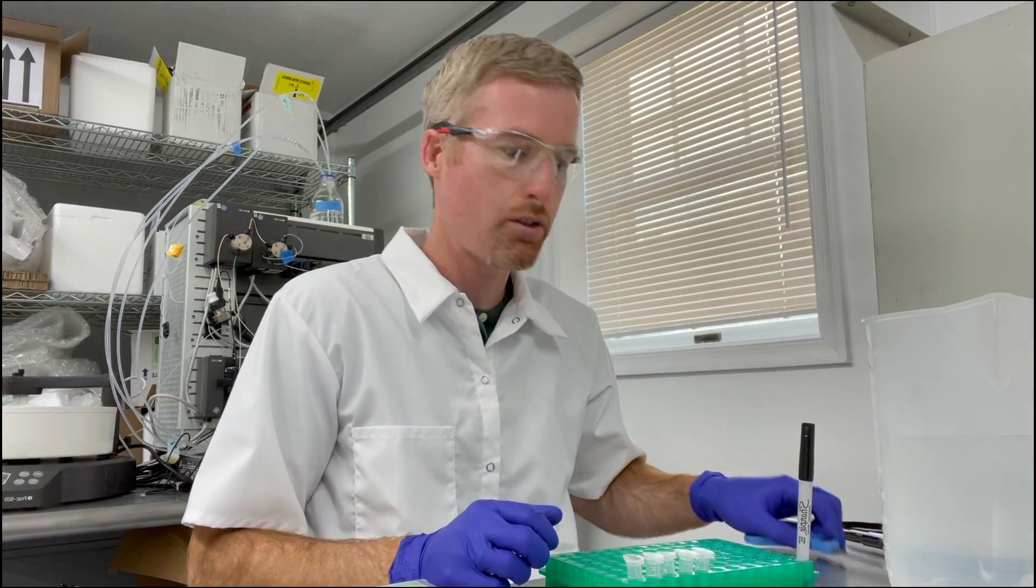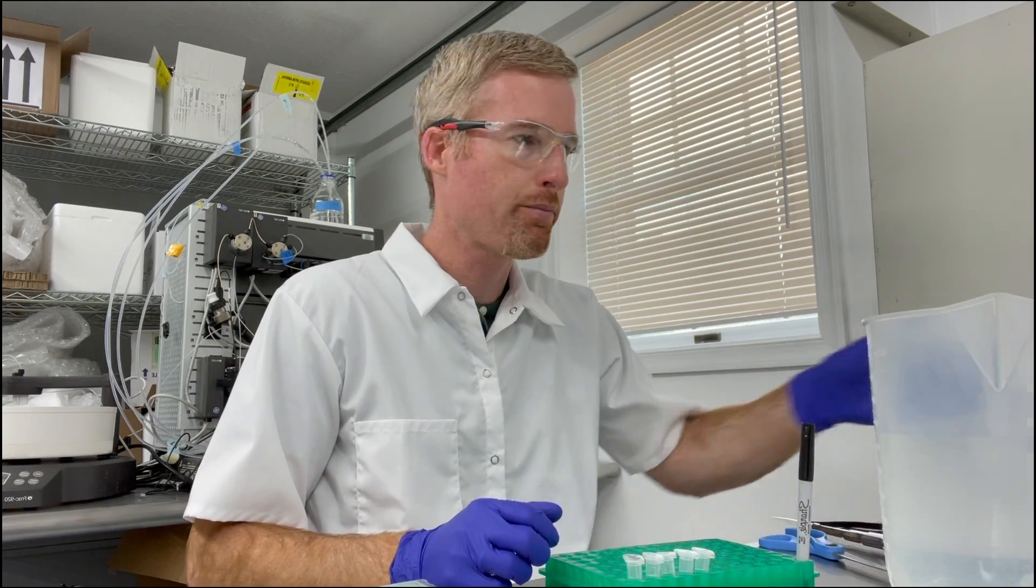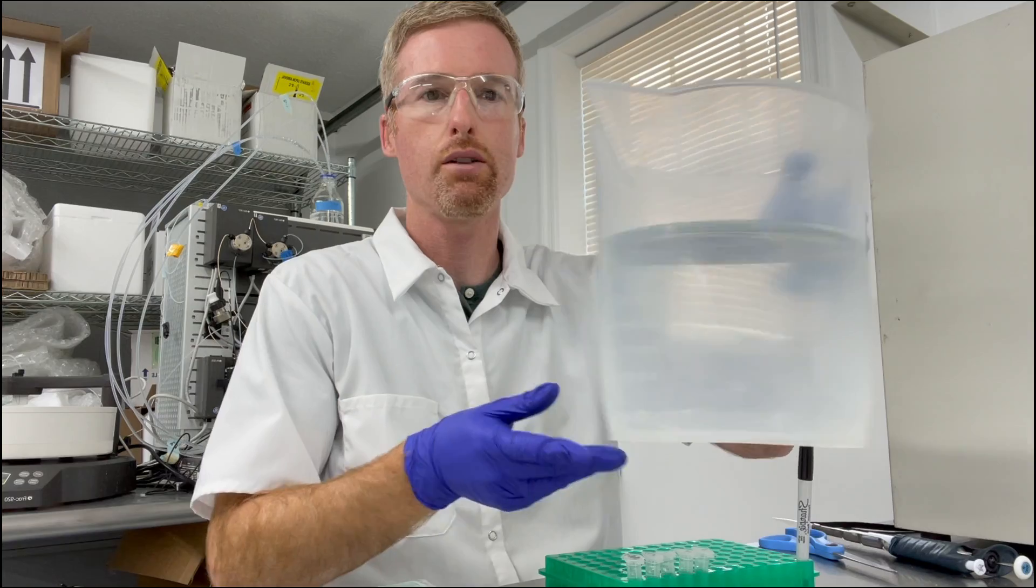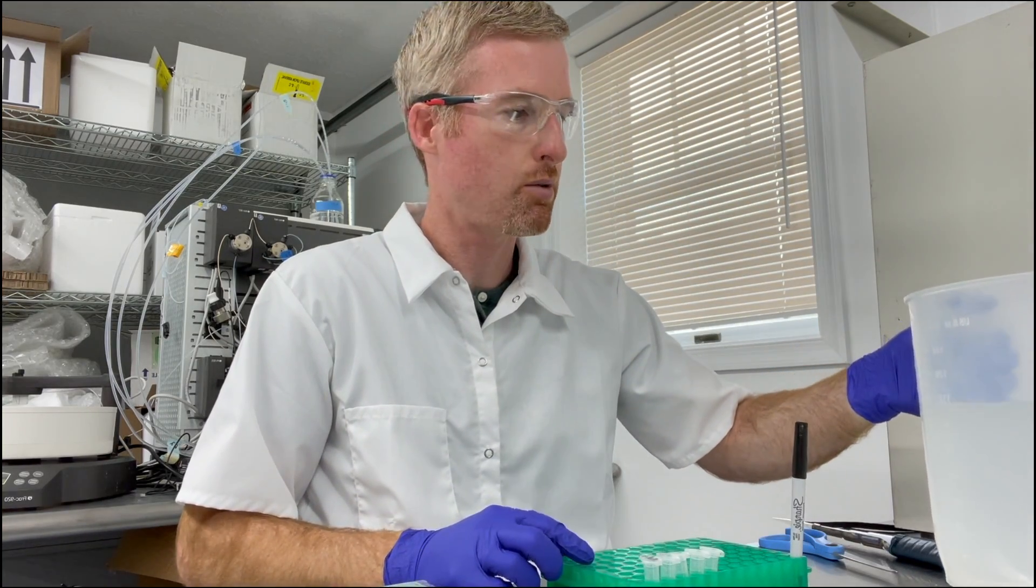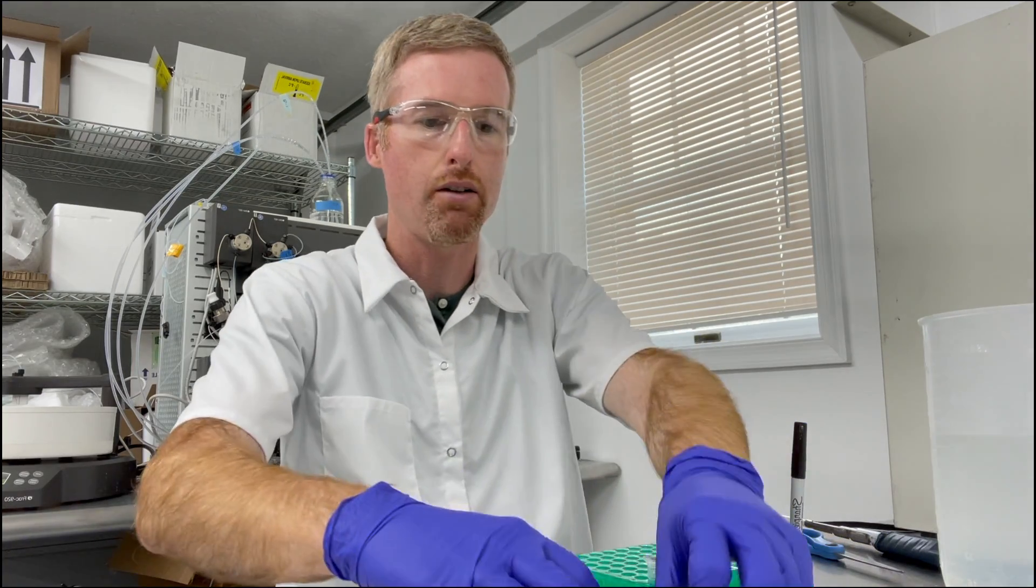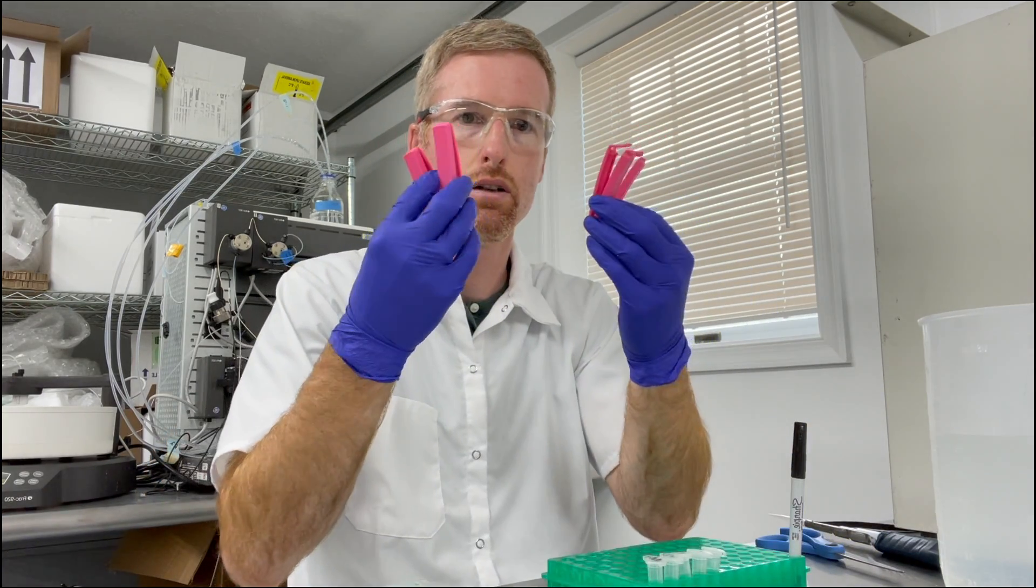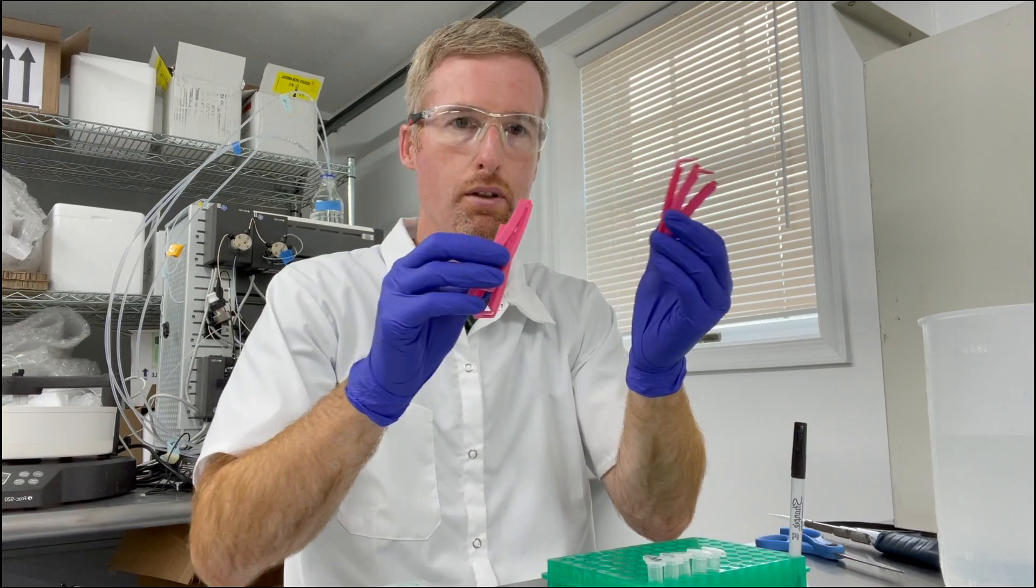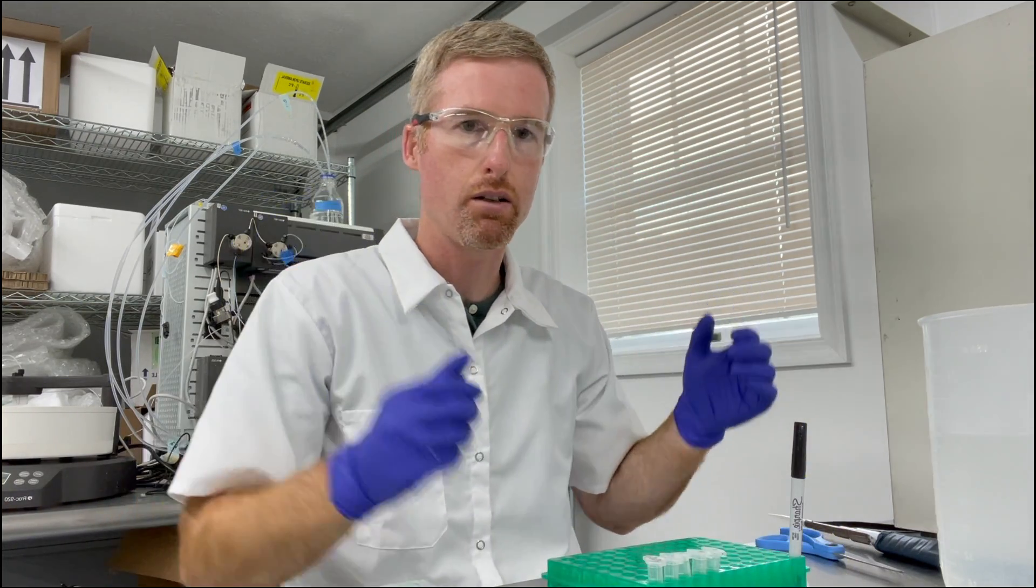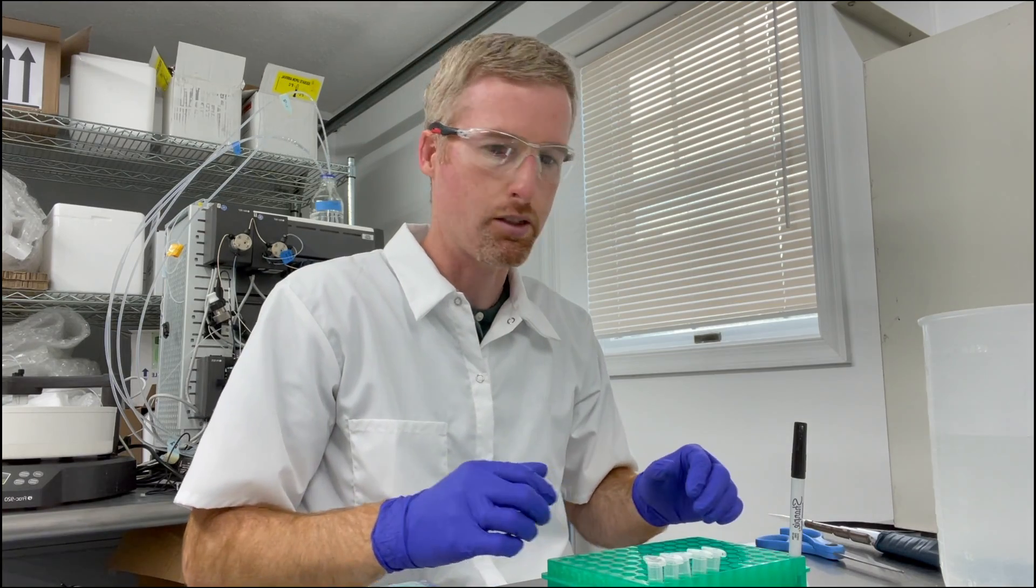I've got scissors, stir bar, beaker with three liters of the buffer that I want to dialyze my protein into, pipette, and I've already got four of the clips opened up so that when I'm holding the dialysis bag I don't have to worry about unclipping them, I'll just slide them on.